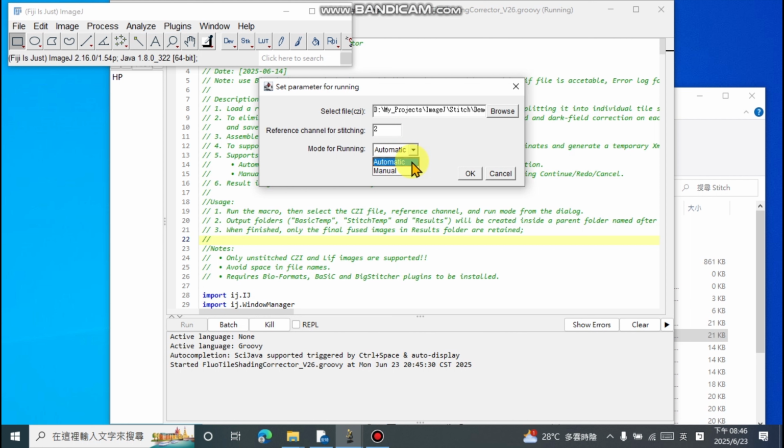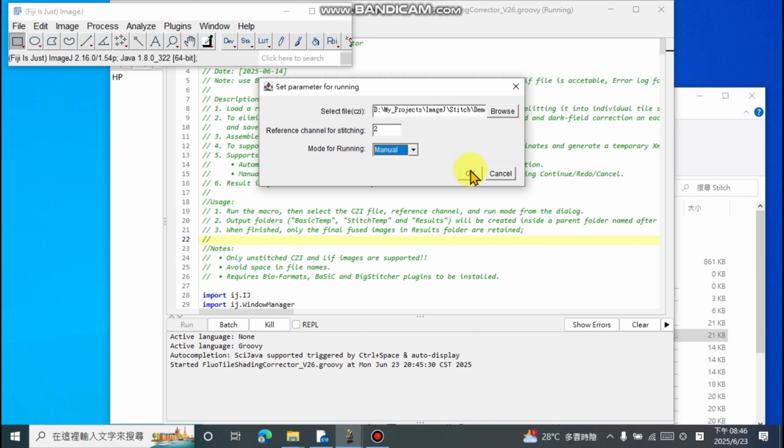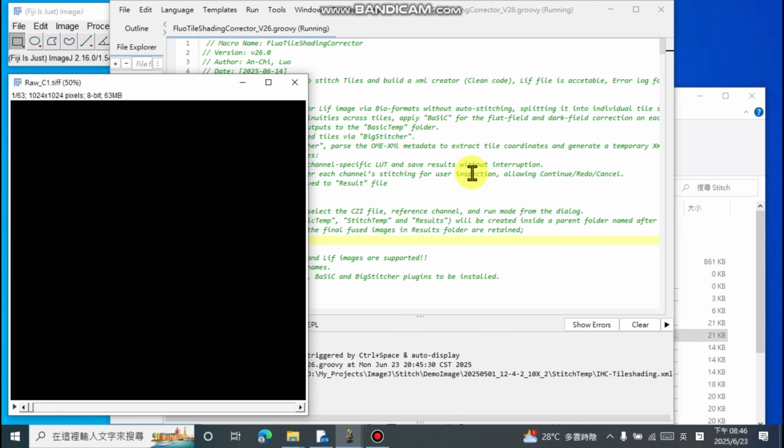If you need to pause midway to check the stitching quality, please choose the second mode, manual mode. This video demonstrates how to use manual mode to calibrate and stitch images. After clicking Run, the program will perform background calibration for each channel. The time it takes depends on your computer's processing power. Remember, file names must not contain any spaces. Additionally, what we need is the original image that has not been processed.